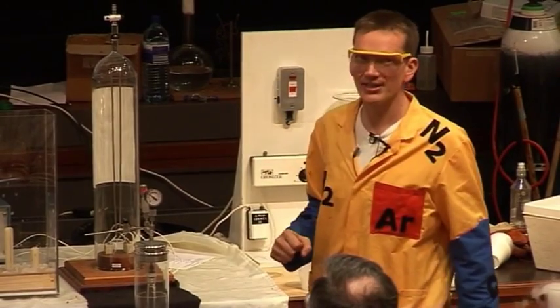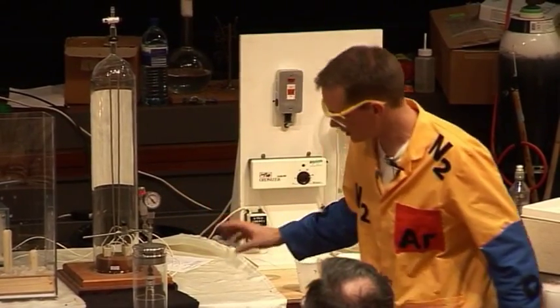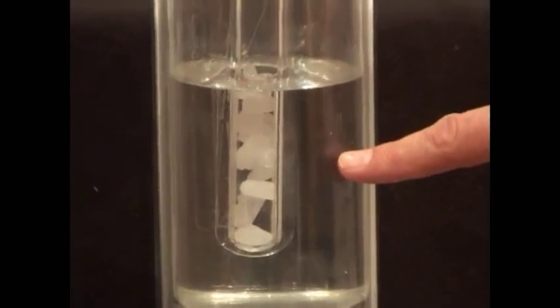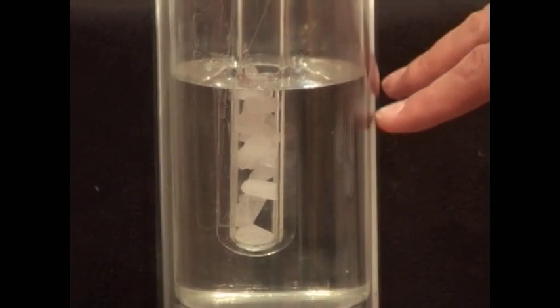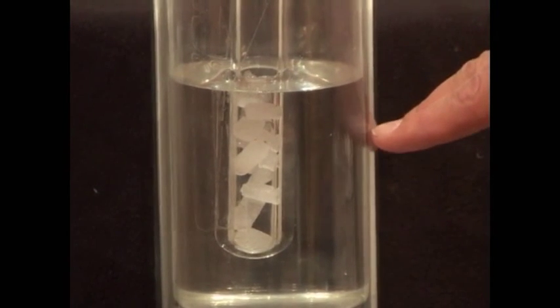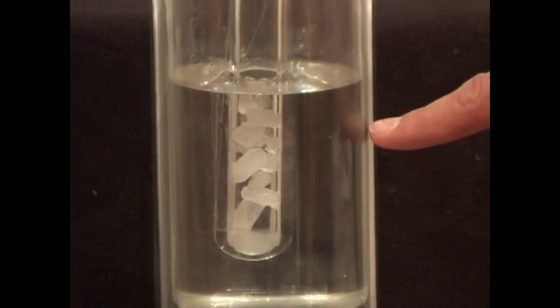Well, this would be very dangerous, but there is a valve to let the pressure out later. But look what's happening down the bottom here — as the pressure builds up and it's just beginning to build up a little bit more, look what's happening to the solid carbon dioxide.